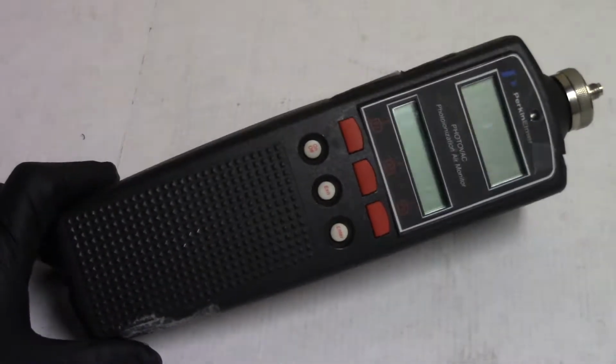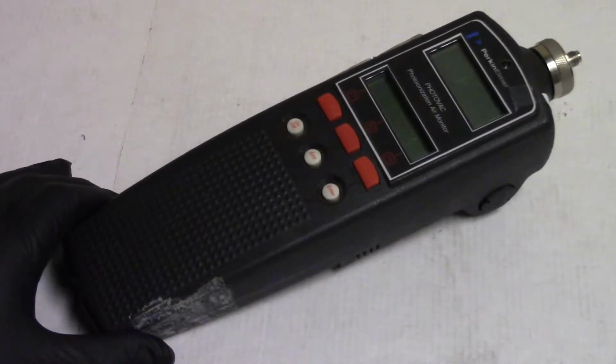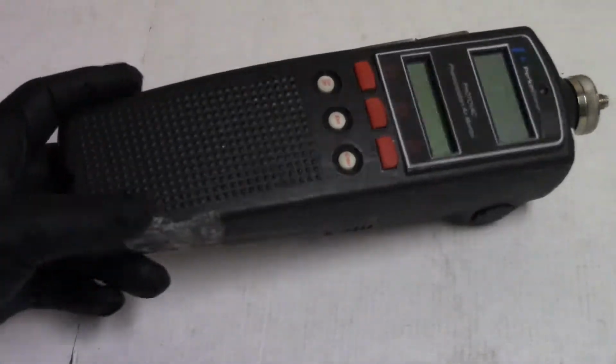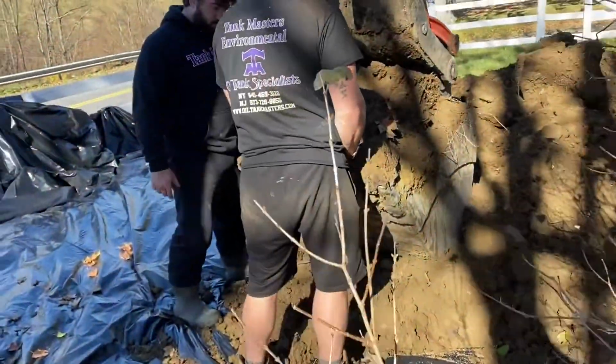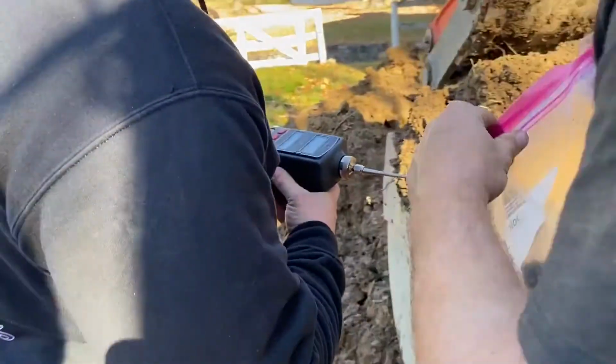The point is that they use a device for checking the soil for volatile organic compounds, a device called a PID meter. Craig and Mike are getting the sample from the bottom of the bucket, and we're going to get a reading.